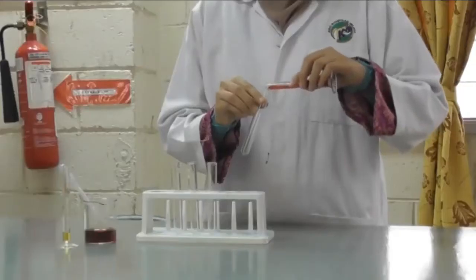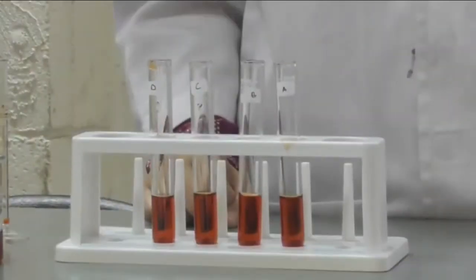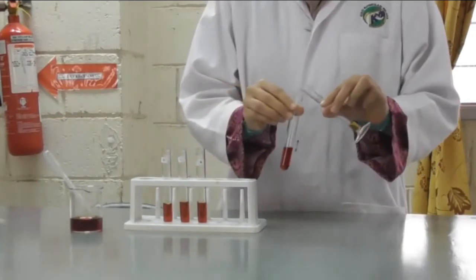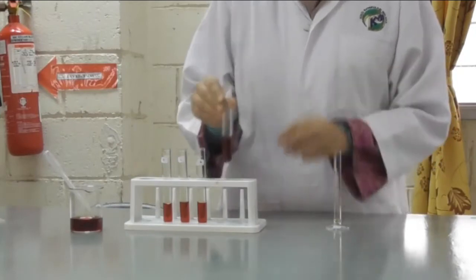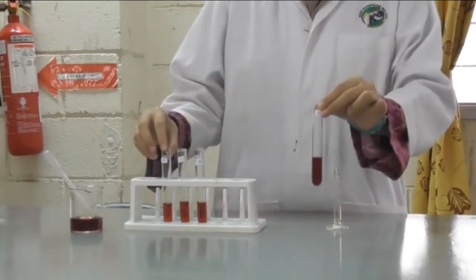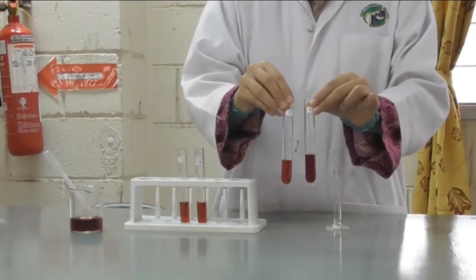Transfer 5 ml of the red solution into 4 test tubes and label the test tubes A, B, C and D respectively. For test tube A, add 1 ml of 0.1 molar iron nitrate. This means in test tube A, the concentration of iron nitrate has been increased, and you can see the effect of increased concentration of iron nitrate towards the chemical equilibrium. Record the observation. You can compare the color of the solution with test tube D, as test tube D serves as control. So, for test tube A now, you can see the observation is the intensity of the red solution is increased, or the red solution becomes darker.